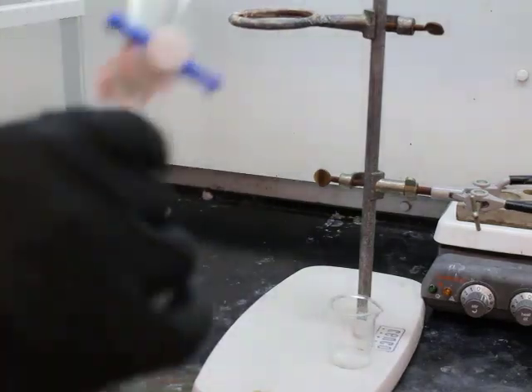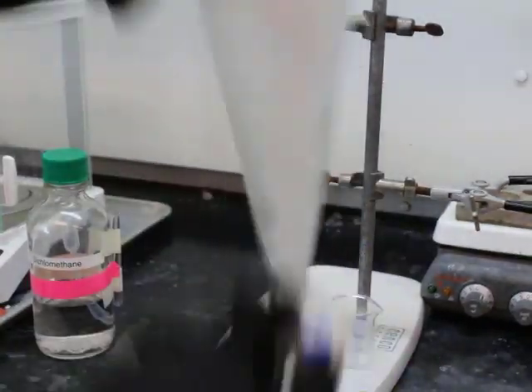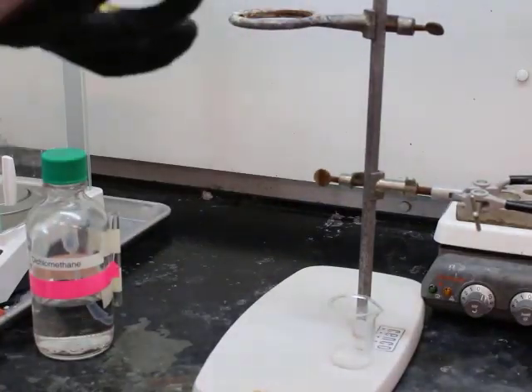Here we're doing it a second time, so shake, shake, shake. Oh, you didn't know I could shake it like that, could you? Woo! I went hyperspeed on that one.